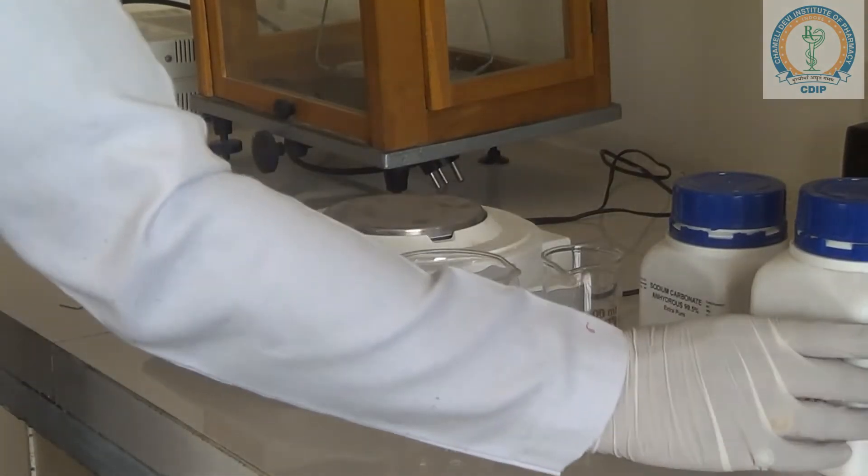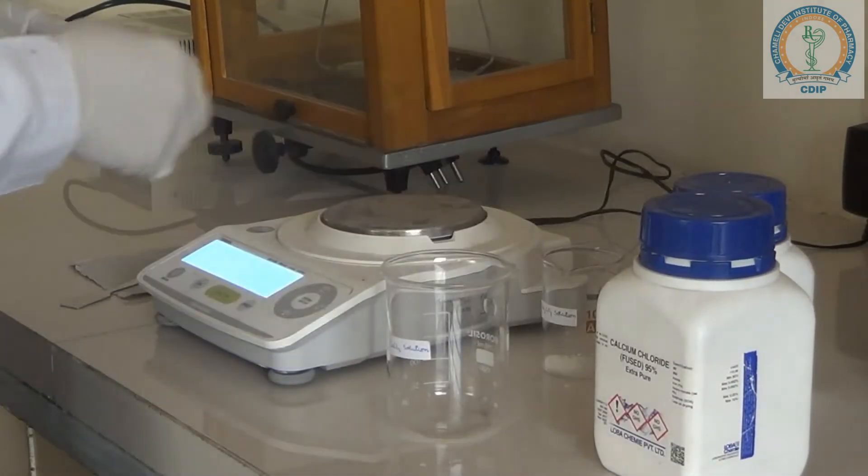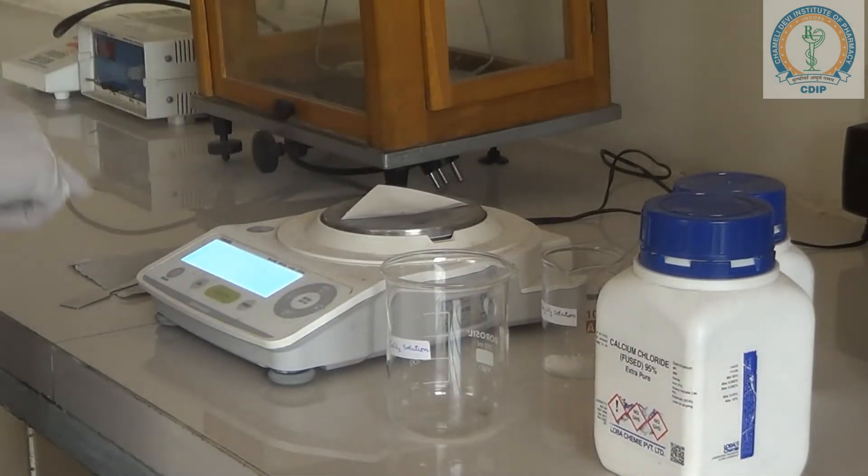Now, after taking sodium carbonate, we are also taking calcium chloride, so we need to weigh it.